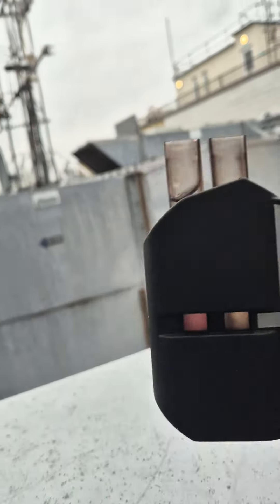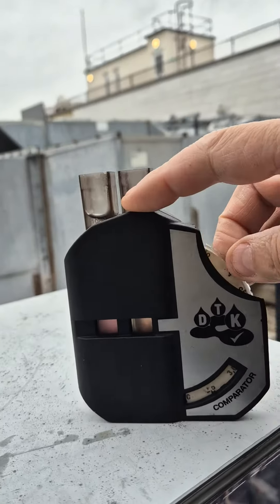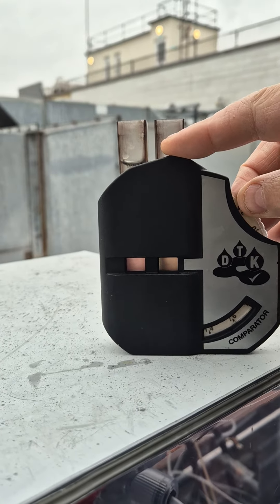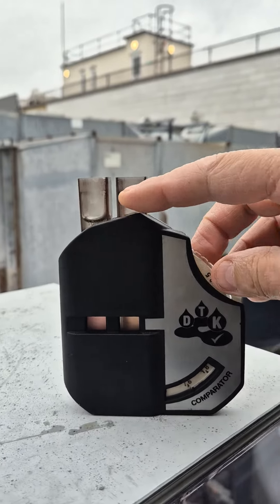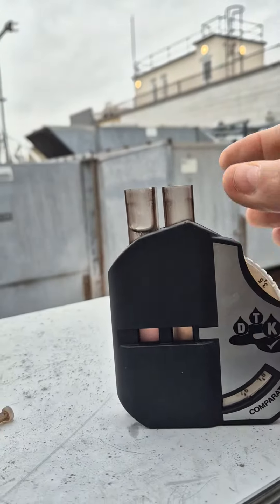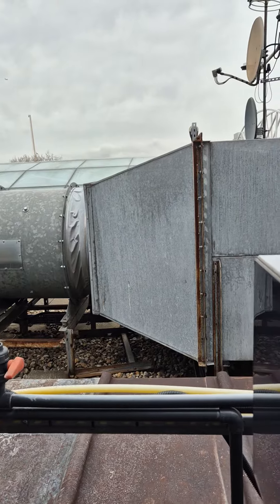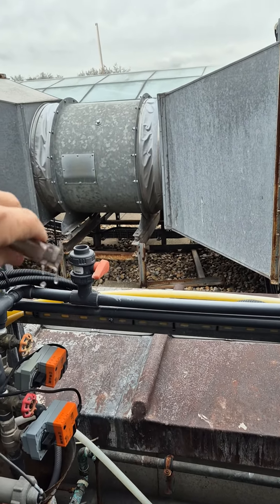All you need to do is match the two colors. Scroll it around until you match your color. This is an old test set so it looks quite manky. That's 1.6 — there you go, it's roughly 1.6. So your result is 1.6.